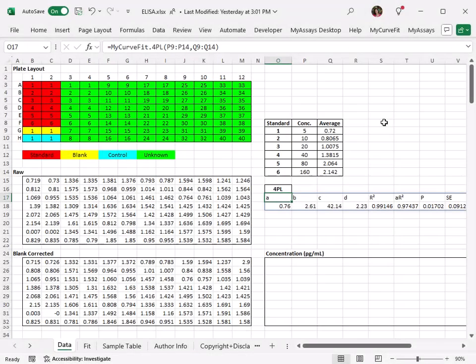In this video, we'll discuss why in certain cases the myCurveFit add-in CalcX function might not return a numerical value, and instead a less than or greater than the asymptote result. I have open an Excel spreadsheet that I've been using to perform analysis for a typical ELISA. If you'd like to see how to configure this spreadsheet, please see the below video.